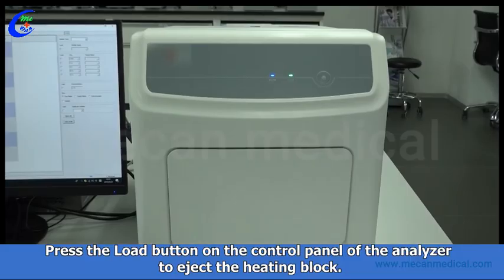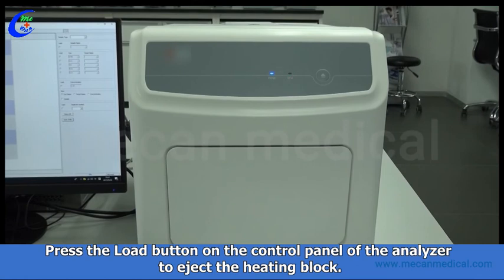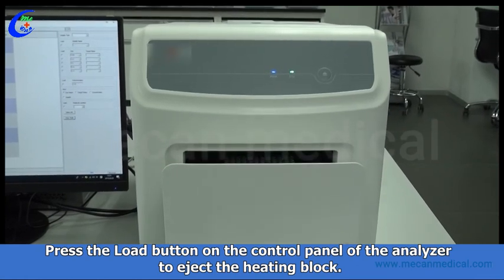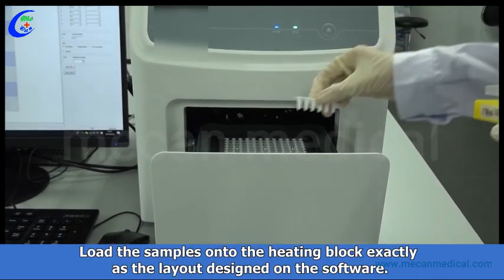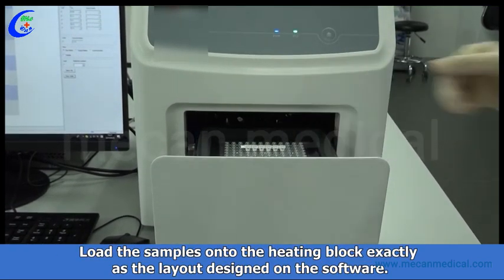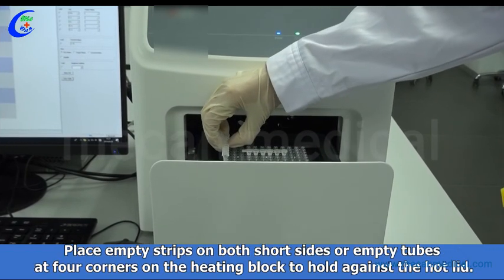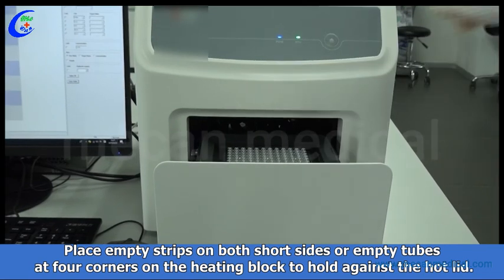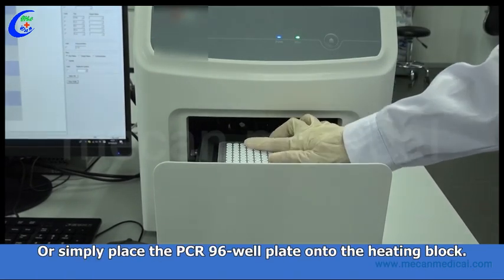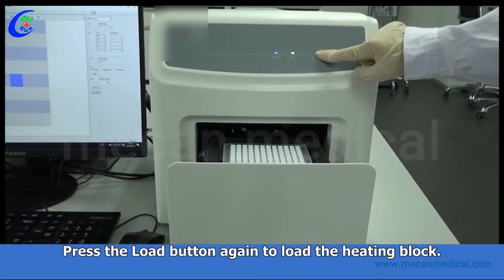Load the sample. Press the Load button on the control panel of the analyzer to eject the heating block. Load the samples onto the heating block exactly as the layout designed on the software. If the tests are too few, for example only several tubes or 8 well strips, place empty strips on both short sides or empty tubes at 4 corners on the heating block to hold against the hot lid. Or simply place the PCR-96 well plate onto the heating block. Press the load button again to load the heating block.